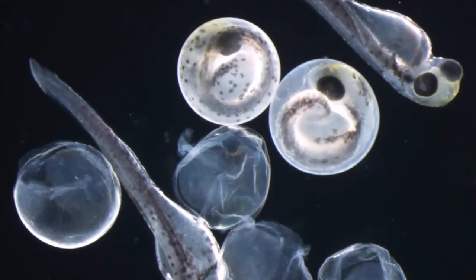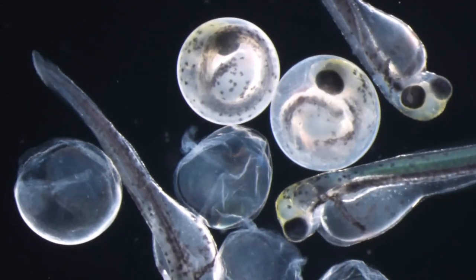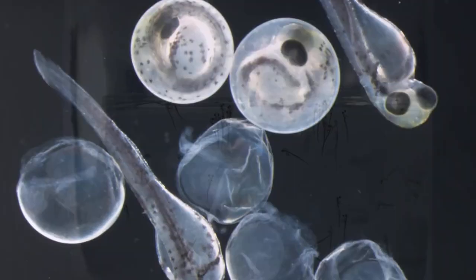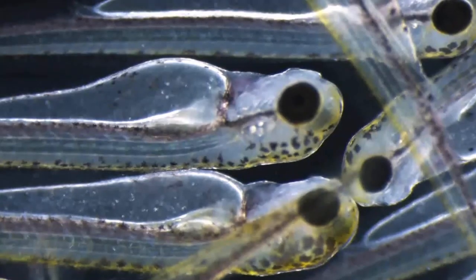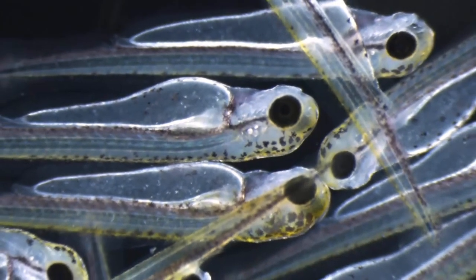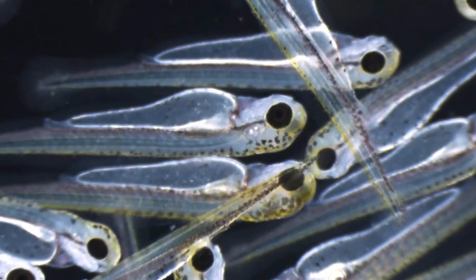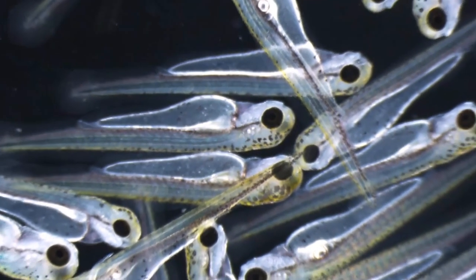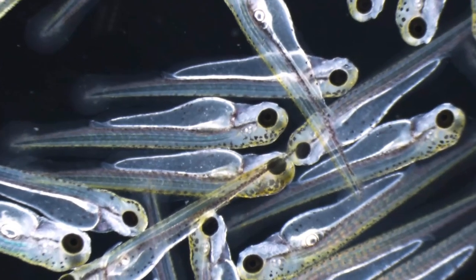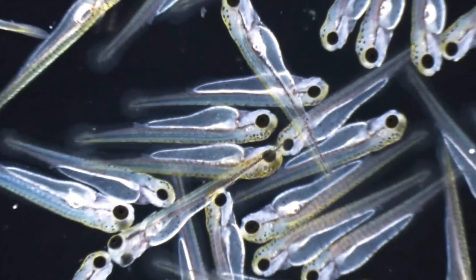However, unlike embryos inside eggs, hatched goldfish larvae and juveniles swim freely. Newly hatched larvae look very similar, making it difficult to distinguish between individuals by appearance alone. This makes continuous observation of the same individual challenging. As a result, it is difficult to determine the order in which tissues and organs appear within the same individual.